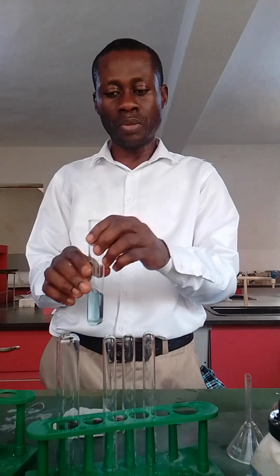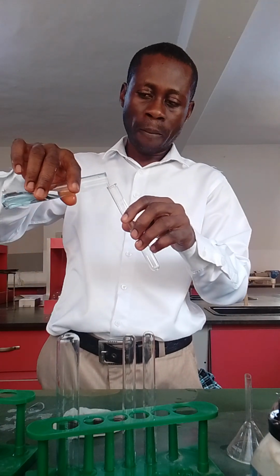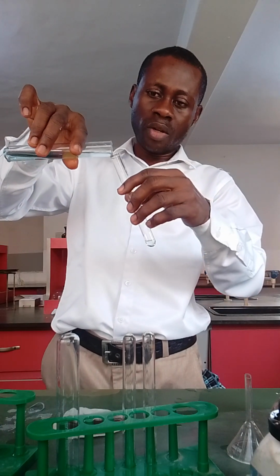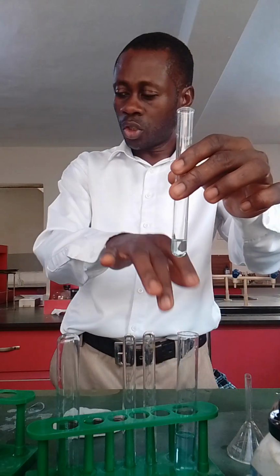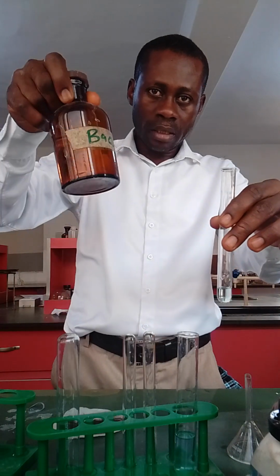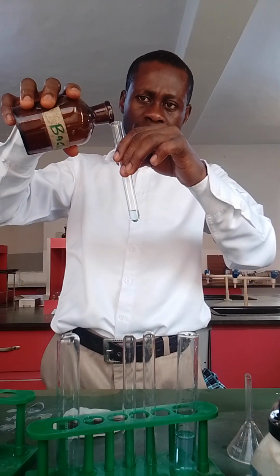Now, should the question say you should divide the filtrate into portions, it could be 2 portions, it could be 3, whatever they say. Just take a small portion, a quantity that will be enough for you to do your analysis. I think this portion is enough. If they say you should add barium chloride to it, this is my barium chloride, your table reagent, which will be provided for you. You put it in drop by drop first and observe what will happen. So let's put barium chloride and see.